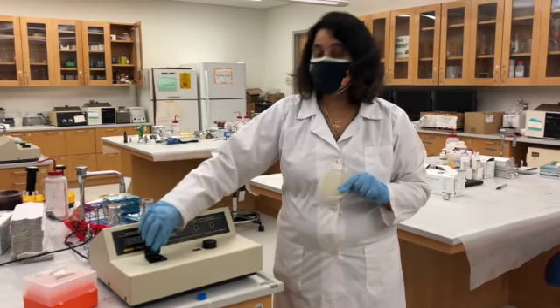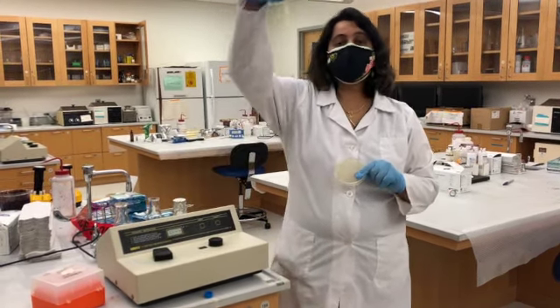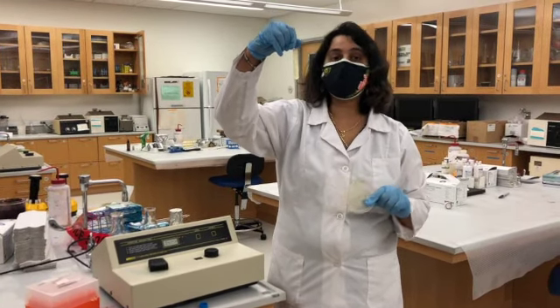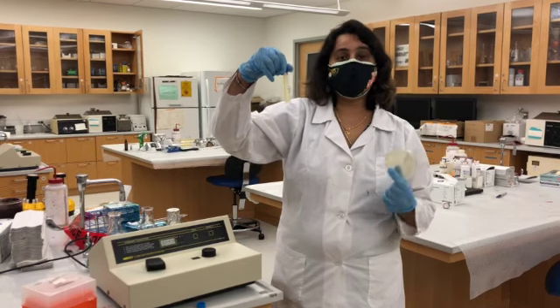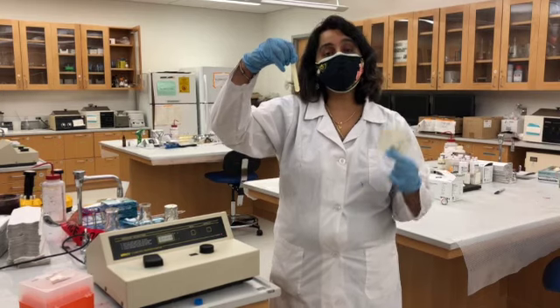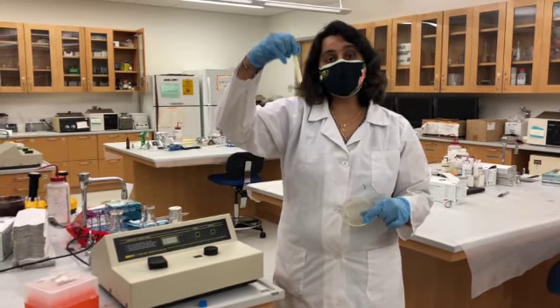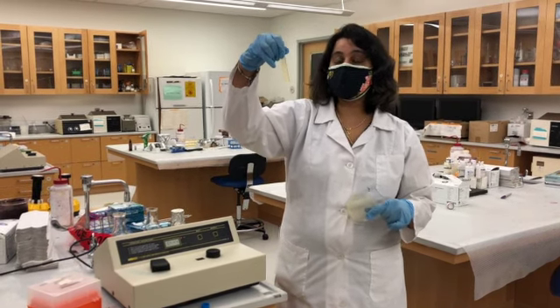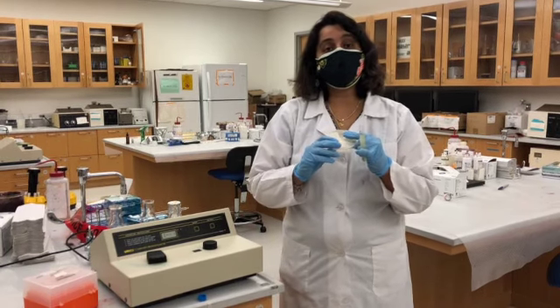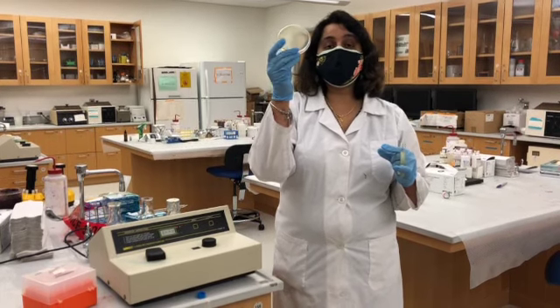I don't know if any of you got the answer. The reason we do both is the absorbance simply comes from the cloudiness. So the cloudiness sometimes can also be from the dying cells. If the cells are dying, they release a lot of cell debris, and that cell debris can also give you an absorbance value. So that absorbance won't actually represent bacterial cells really growing, but actually it's the cell debris. So just to make sure you're not missing out on any of those dying cells, you grow the bacterial cells on the solid plate.